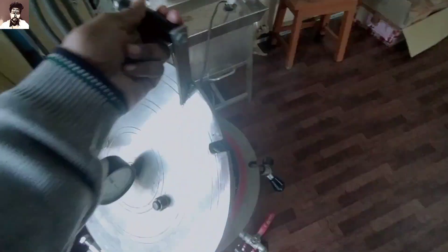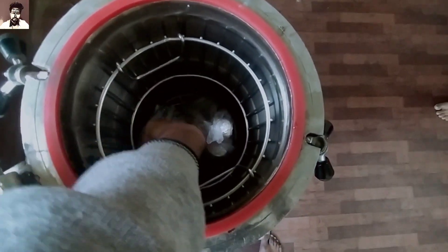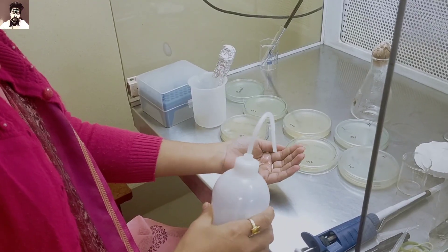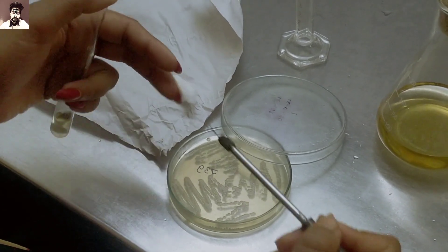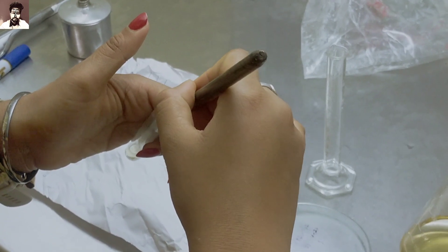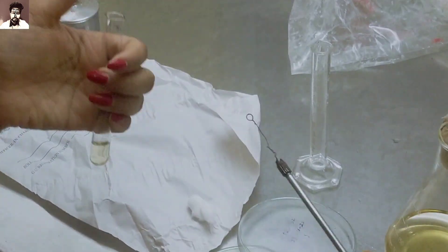Finally, we will analyze this anti-bacterial property. Before proceeding, we will sanitize the workspace. The glass plate with nutrient growth medium will be prepared to grow the bacteria, which we will use for anti-bacterial activity testing.